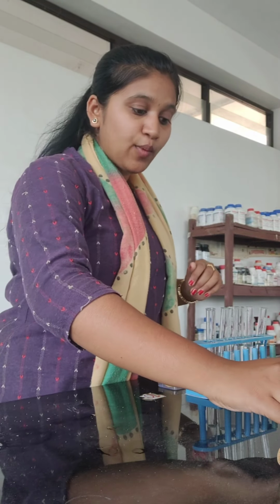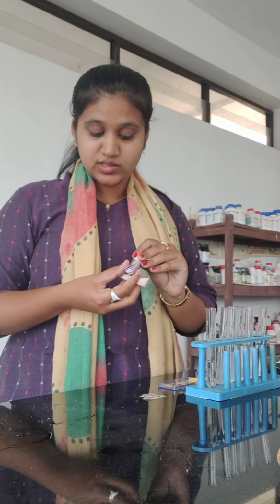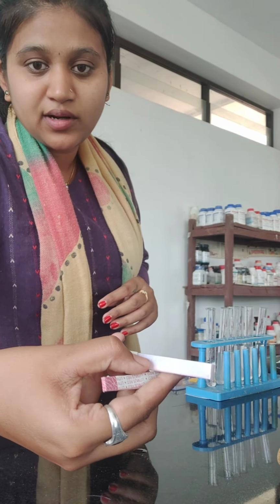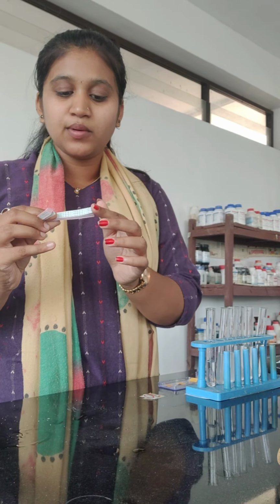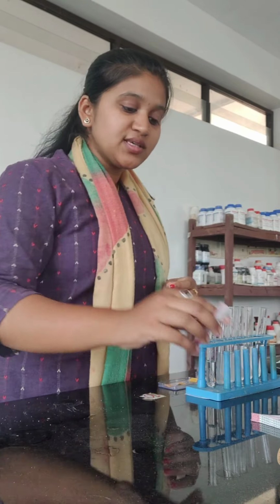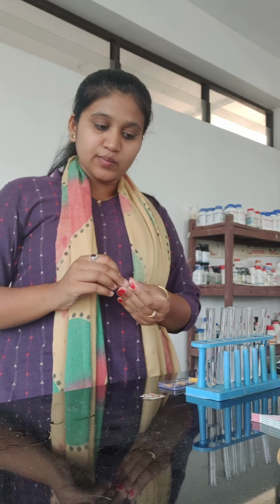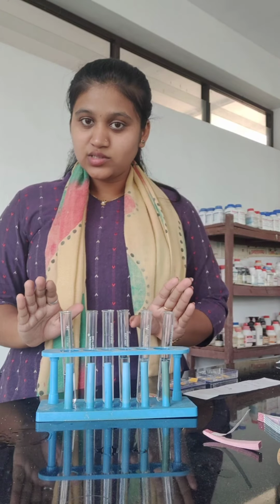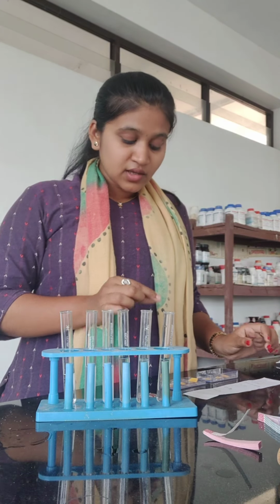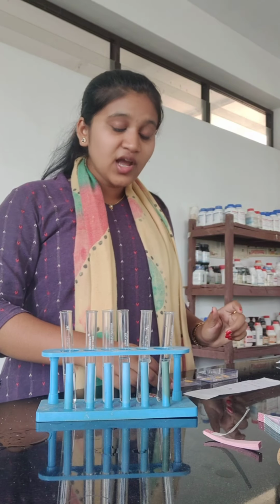After knowing this about the pH scale, we will see how the red litmus and blue litmus looks. This is blue litmus paper. It is blue in color and it comes with the strips which may be around 20 in a single strip. Similarly, red litmus paper. Red litmus is red in color and blue litmus is blue in color. So we have taken the number of solutions here. Consider these as an unknown solution. We will add drop wise solutions to the pH paper to check the pH and observe.